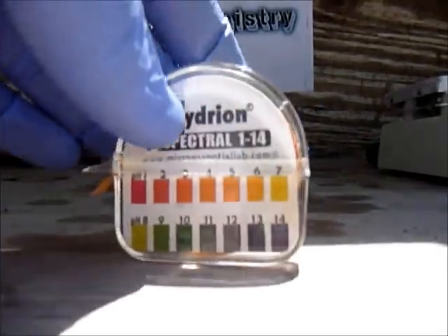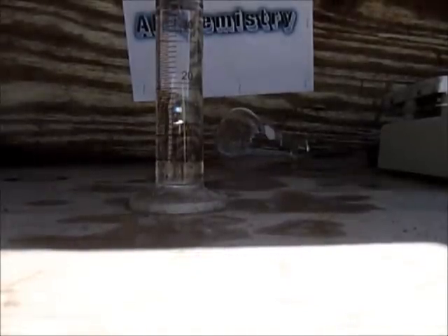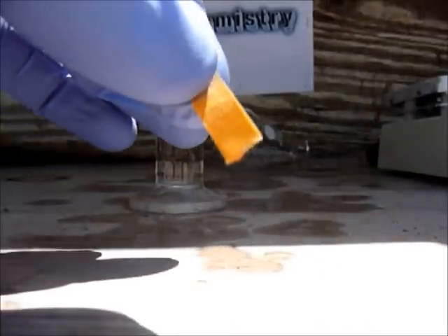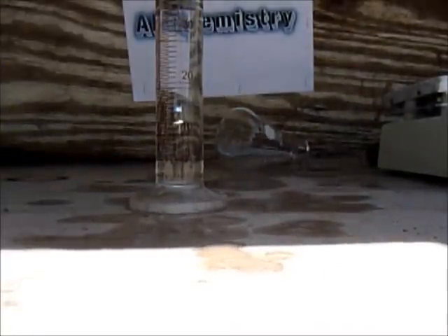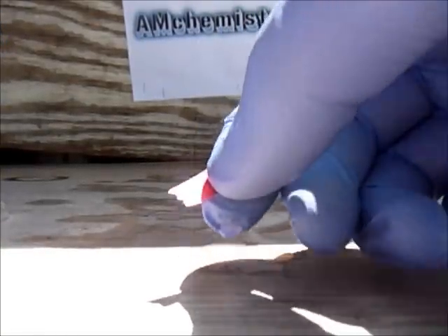To test for it, you need pH paper. If it turns red, that means it's an acid. First, check neutral water — as you can see, it doesn't have a major color change. Now if you try with the hydrochloric acid I made right there, it should change color. You see — it changed to a red color.